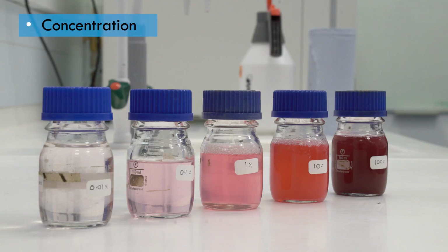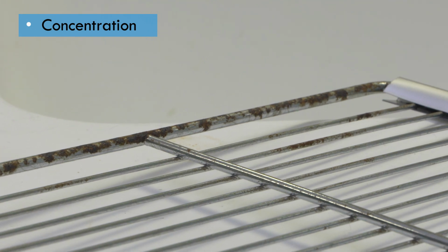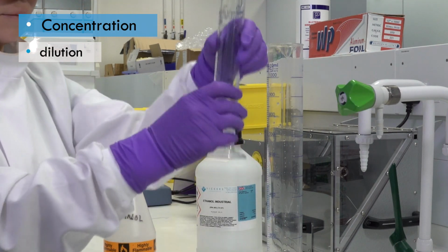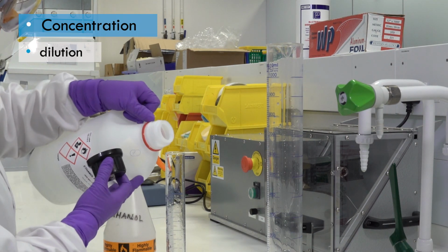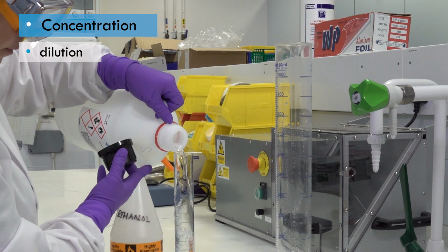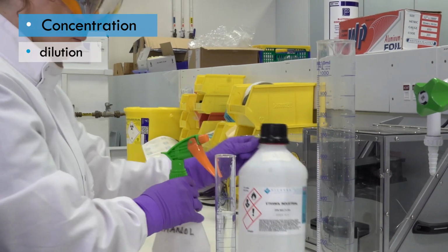Correct concentration is very important. Too low, and it will not reduce the numbers of biological agents to a safe level. Too high, and the disinfectant could damage the surfaces it contacts. Disinfectants are usually supplied in a concentrated form and need to be diluted before use. You should read the manufacturer's instructions carefully, as different concentrations may be needed for different biological agents. For example, a higher concentration may be specified for use with spore-forming bacteria.